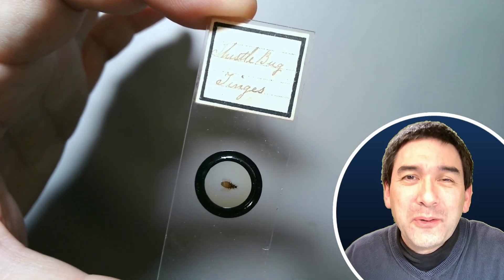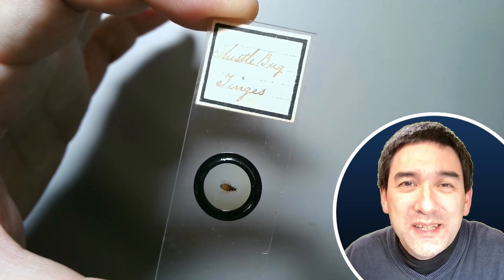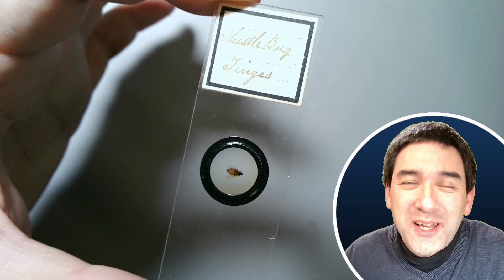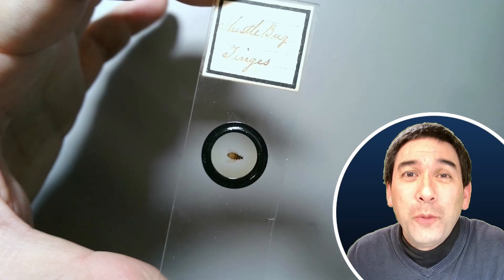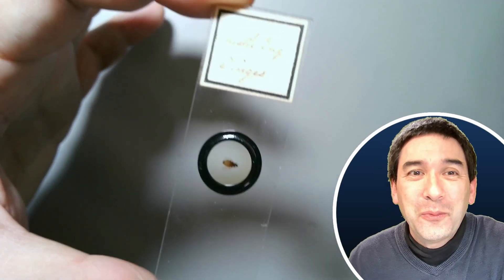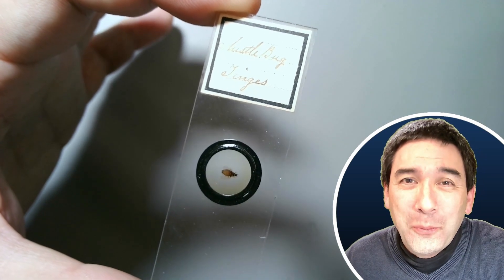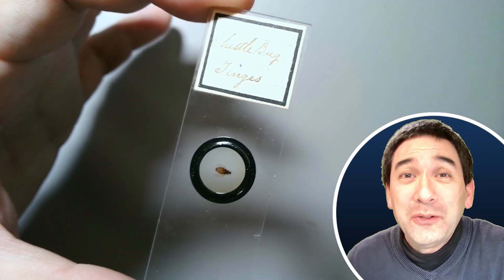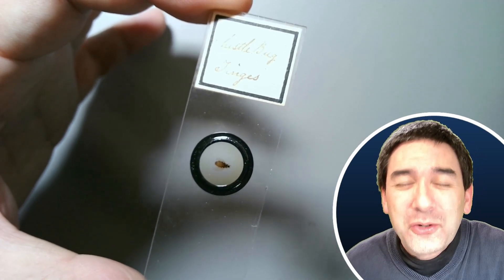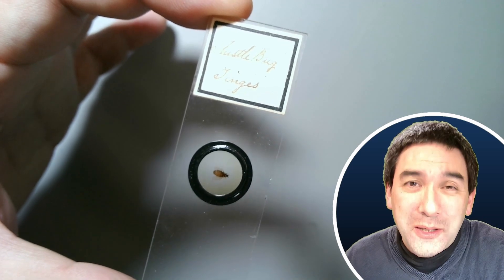So maybe some of you are able to help out here, and maybe you're able to help give this insect a name and identify what it is. So if there are any hobby entomologists out there willing to help, please do leave your comments. But what I'm going to do now is put it under the microscope, because it indeed does look quite pretty.